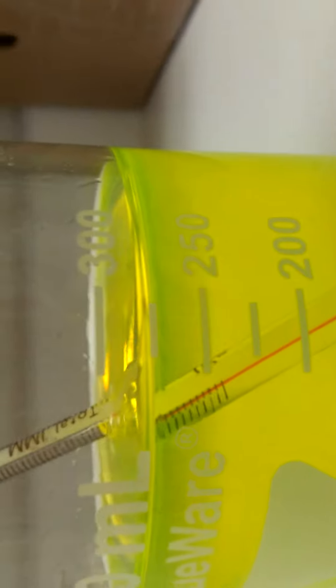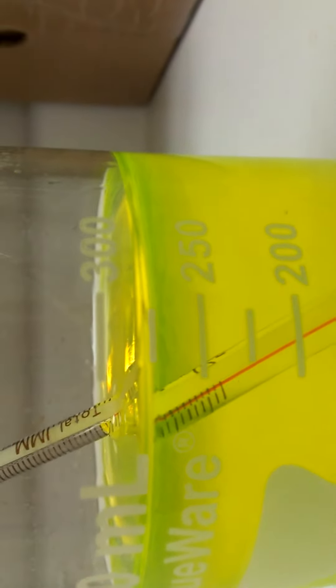Here is the liquid. Look at the water. Remember, when I put it in, it was warm.